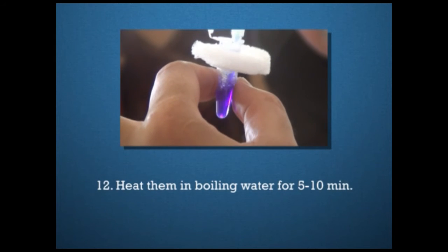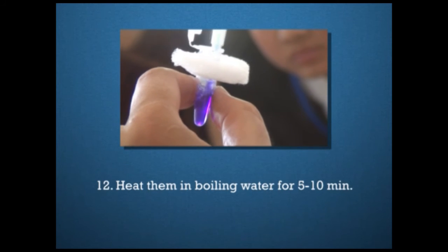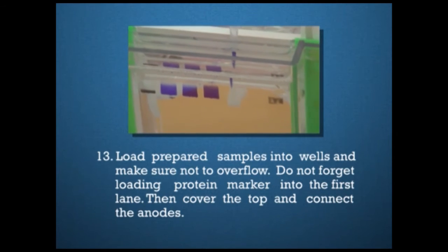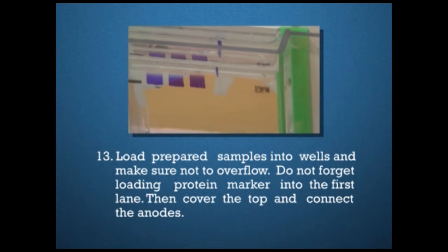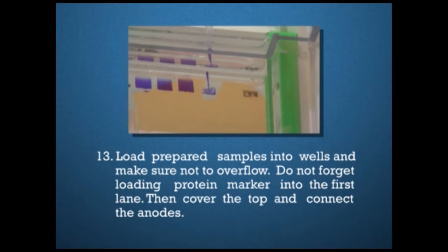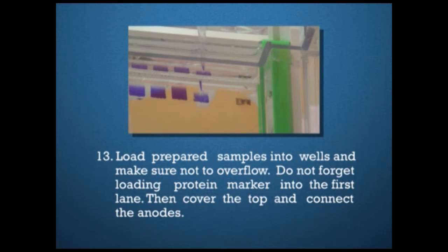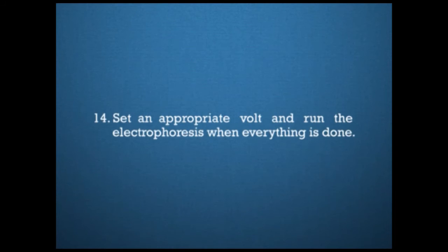In the next step, heat them in boiling water for around 5 to 10 minutes. Next, load the prepared sample into wells and make sure not to overflow. Don't forget loading protein markers into the first lane. Then cover the top and connect the anodes. Next, set an appropriate voltage and run the electrophoresis when everything is done.